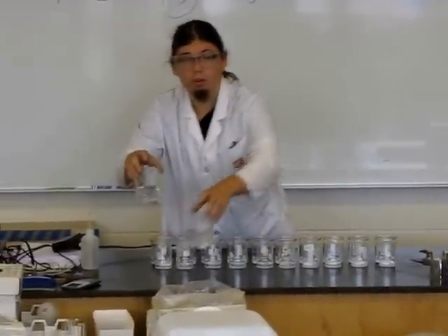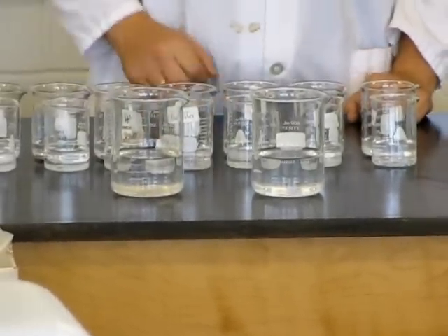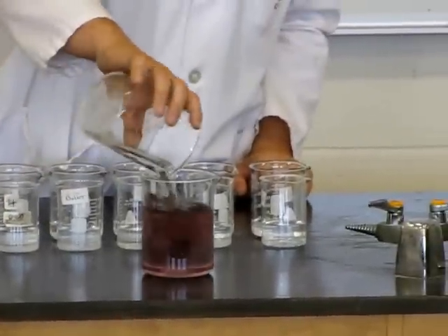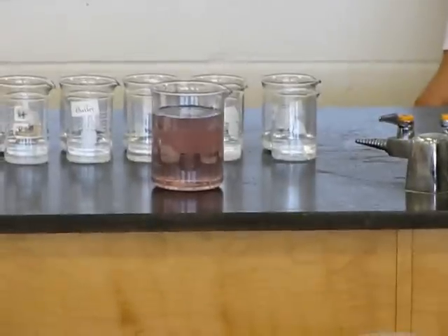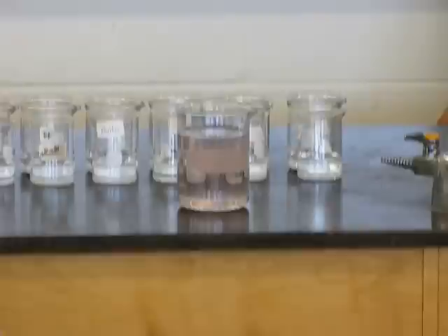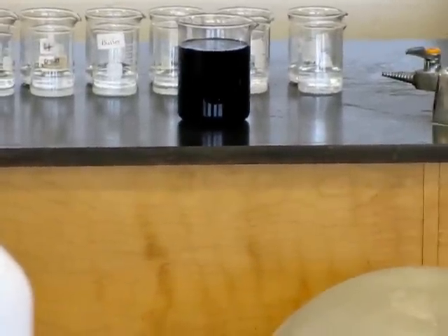Another one. This one involves iron in the 3-plus oxidation state, which some of you will learn about at that stage. Again, it has more than one colour change. OK, I quite like that one — that's one of my favourites.